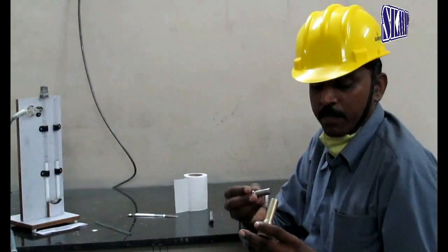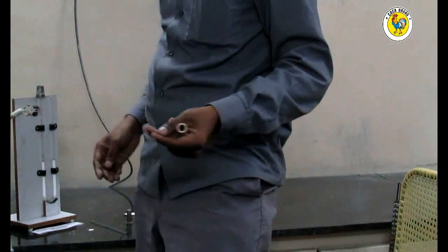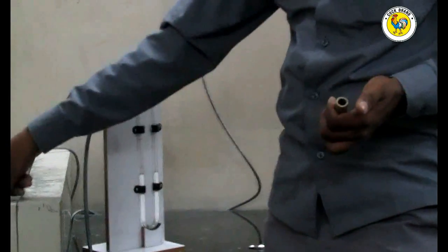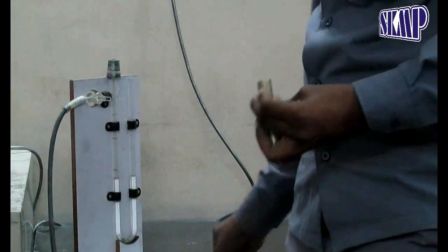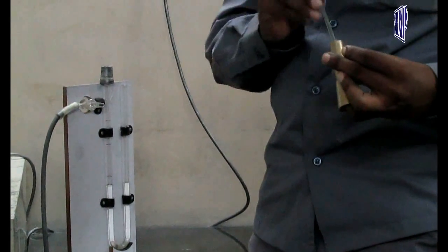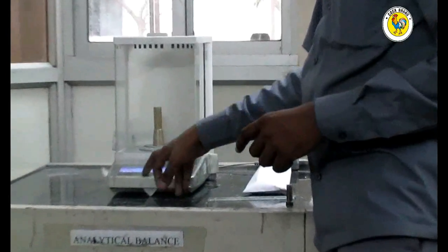This is a cell which is calibrated using standard cement. This is a perforated disc. This is a plunger and this is a sample cell. Now I insert the perforated metal disc into the sample cell, then insert one filter paper disc into the cell and place it over the metallic filter disc. Now I tare the sample cell.